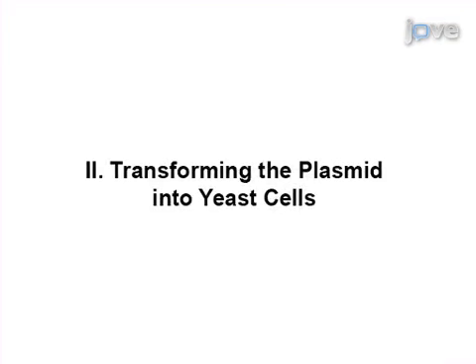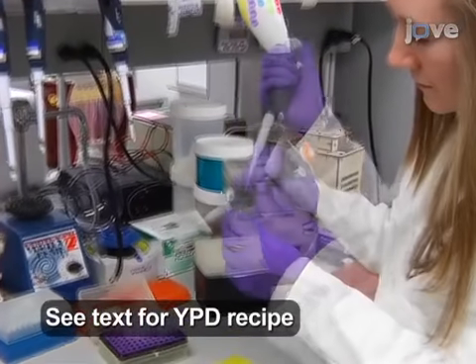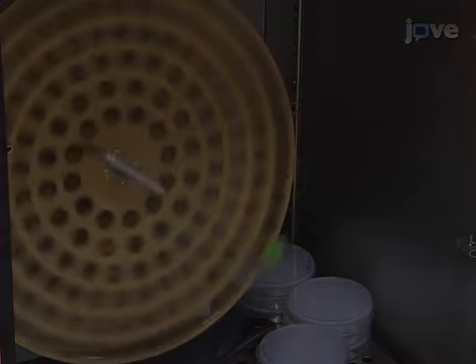Begin this protocol with generation of the Aip1p GFP plasmid and mutant yeast strain as instructed in the text protocol. Digest the plasmid with a restriction enzyme to allow integration into the yeast chromosome. Culture the prepared S. cerevisiae.